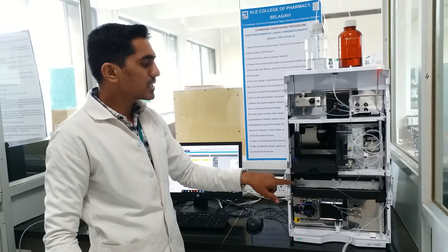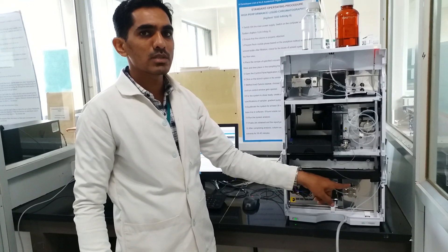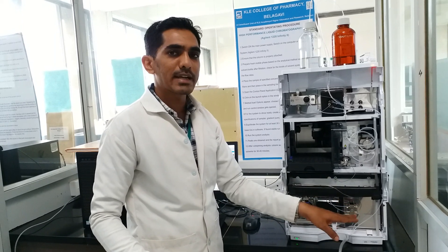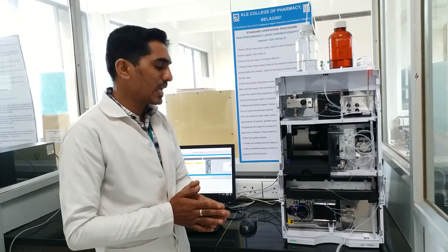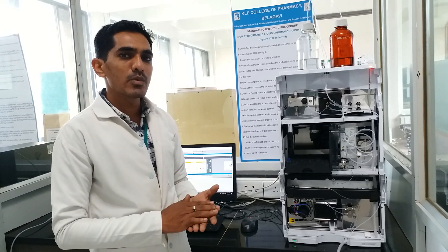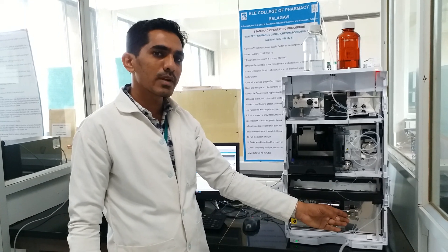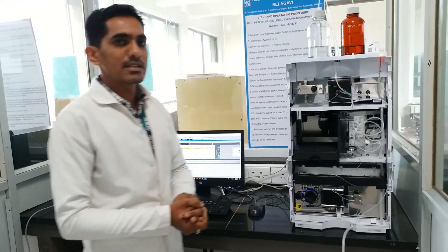Once the analytes are separated from the column system, they are sent to the detector part. The detector helps detect the compounds that have been separated from the stationary phase. They are detected with the help of UV or PDA detectors. There are different types of detectors in HPLC: PDA detector, UV detector, refractive index detector, and fluorescence detector. In our HPLC we have the PDA detector. Once detection is complete, the waste is collected in the waste collector.